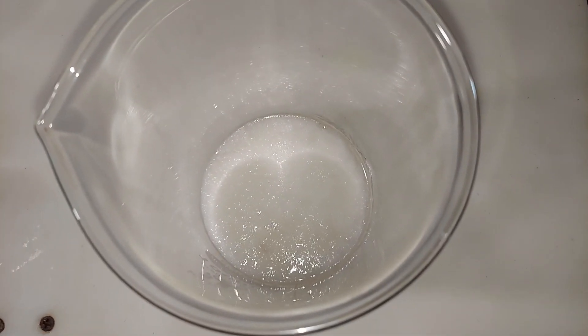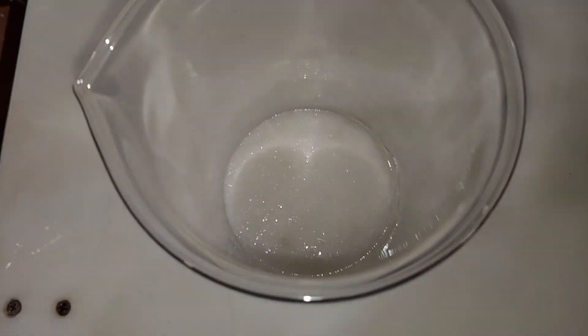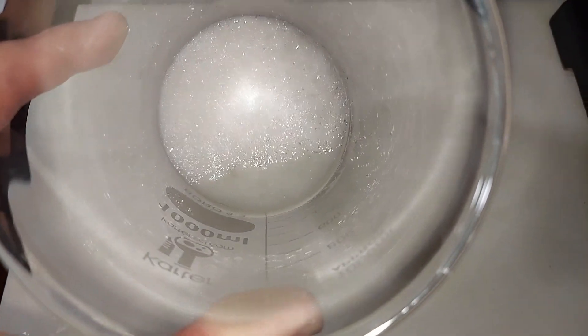This is about two hours later. I was messing around with some other things here and just came back and looked at it, and the lead acetate has completely formed. That's pretty quick, but hey that's great. So I'm going to filter this to collect the solids.